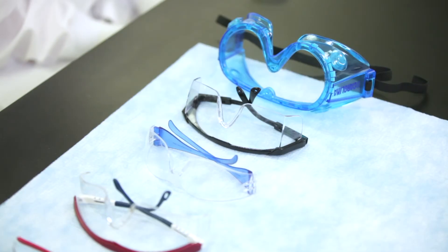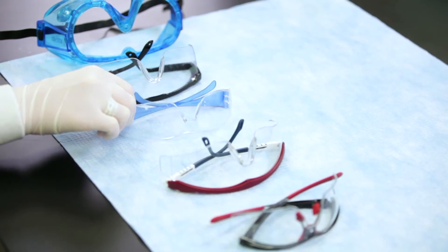First, before working in a lab, you must be sure to wear your personal protective equipment, PPE. Choose PPE appropriate to the hazards you are working with.